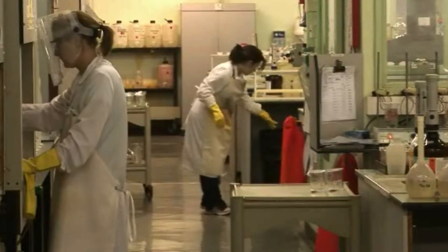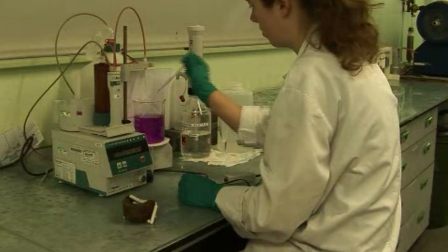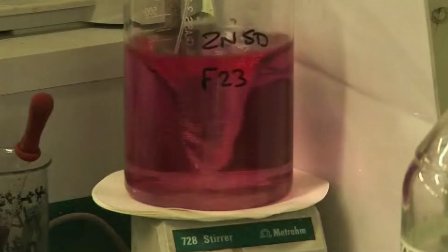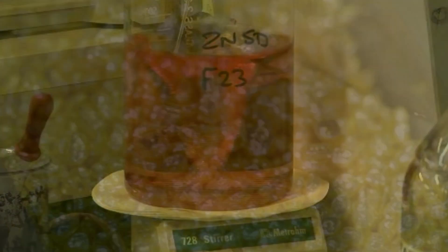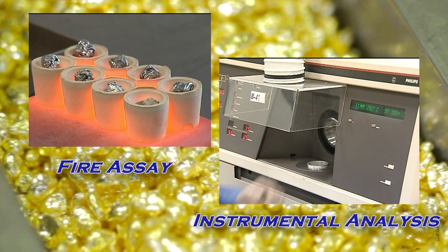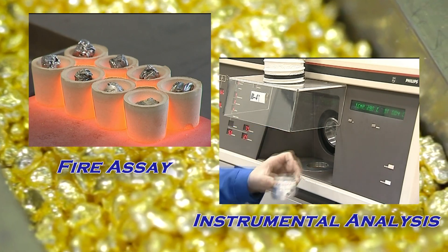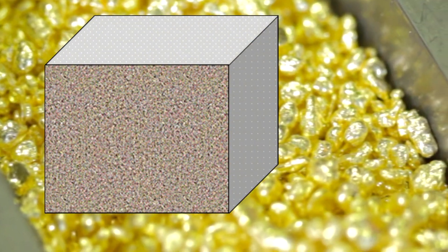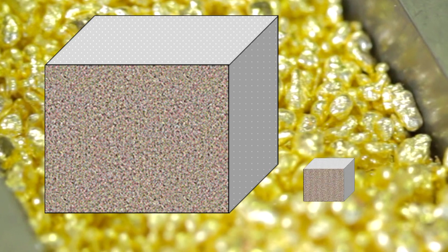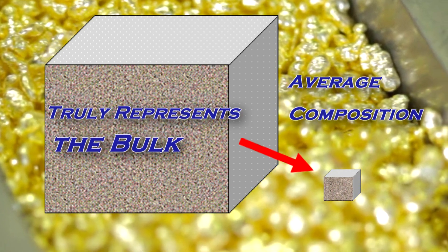There are over 200 analytical techniques used to determine precious metal concentrations in materials. Methods range from classical wet chemistry to fire assay and instrumental analysis. Our prior videos discussed the importance of obtaining a true sample in the various instrumental analysis methods.